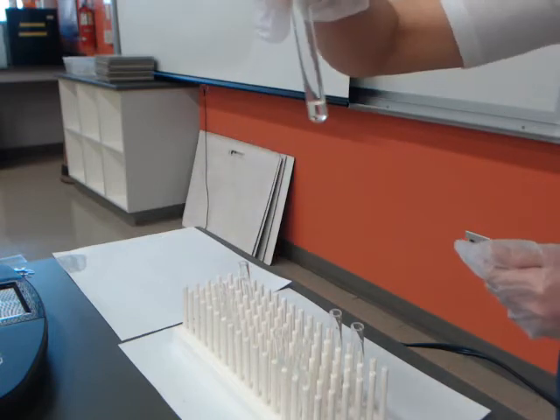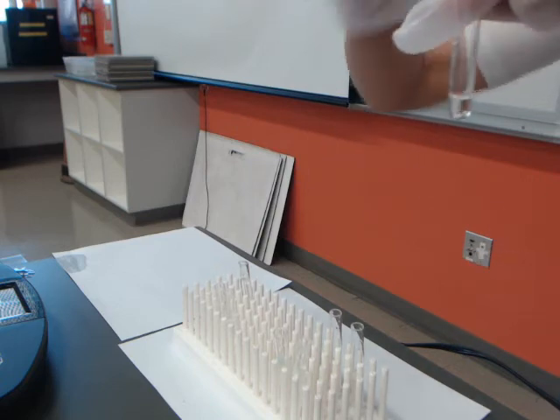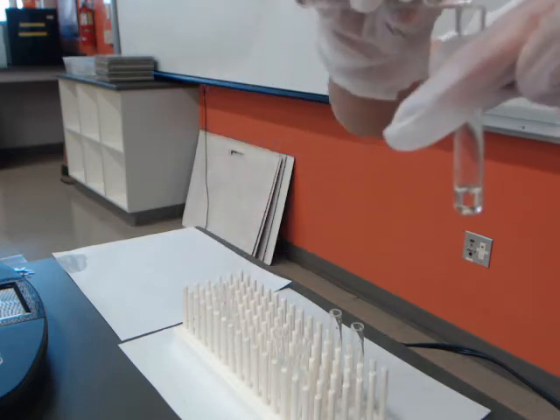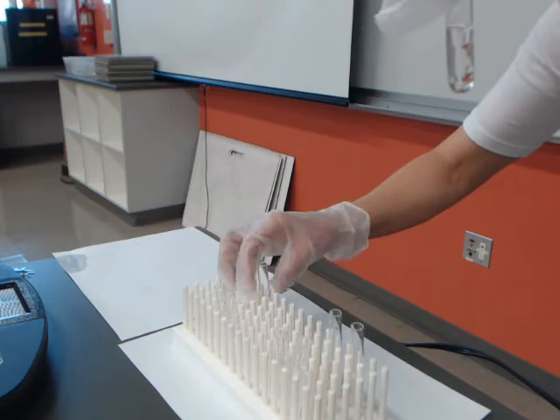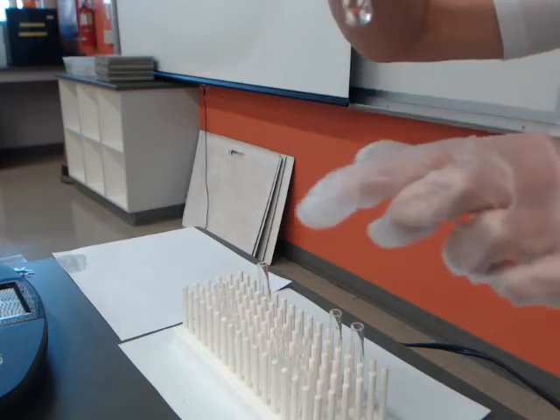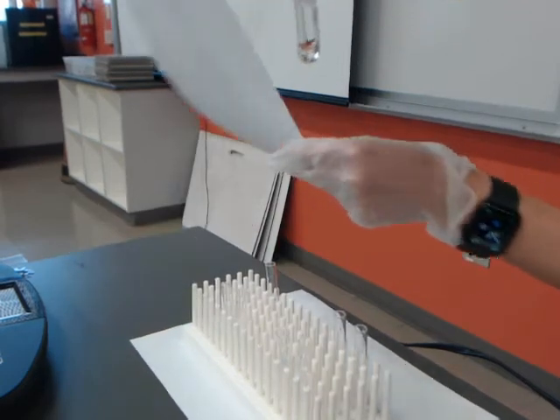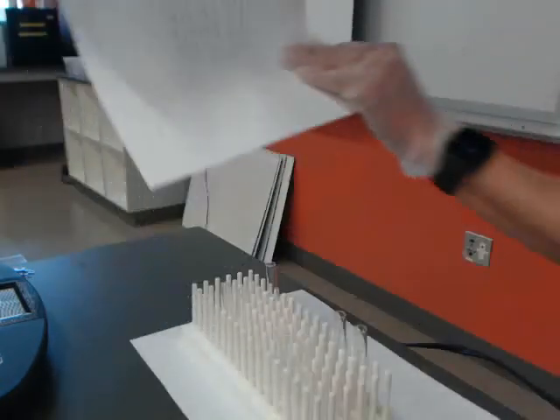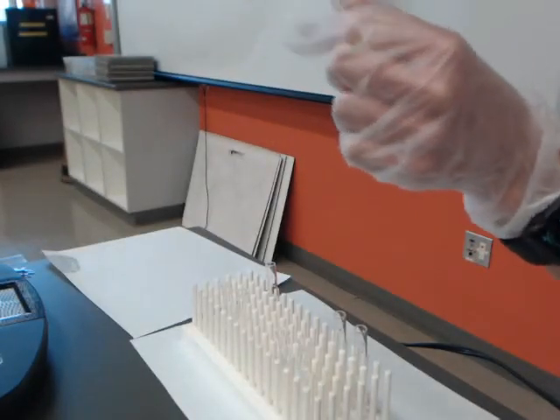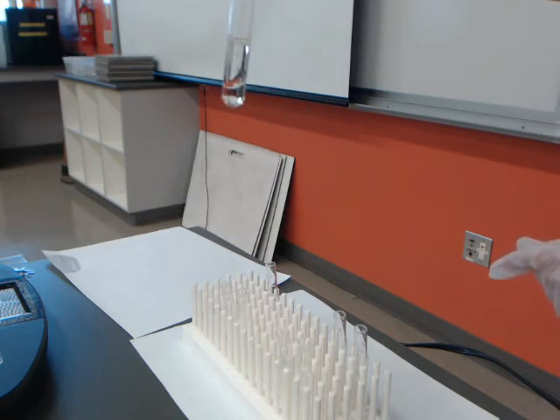Then you've got vegetable oil in test number 4. Vegetable oil is kind of thick. And I'm going to pour some water in to the vegetable oil. And they did not mix. You can see a sort of little division. It's kind of hard to see, but maybe against this white paper it's a little bit easier, or not. But you can see that there's a division between where the vegetable oil is and where the water is. So they did not mix.